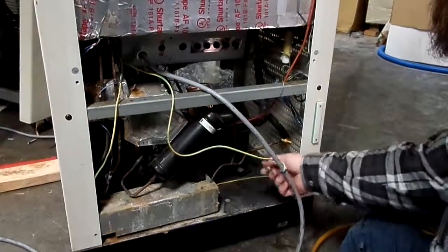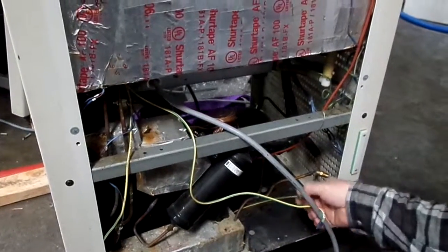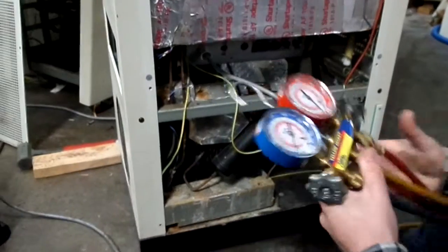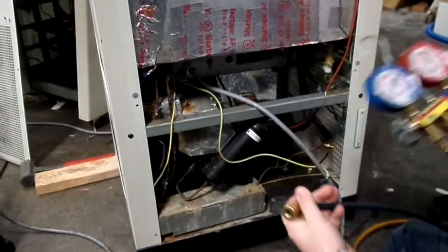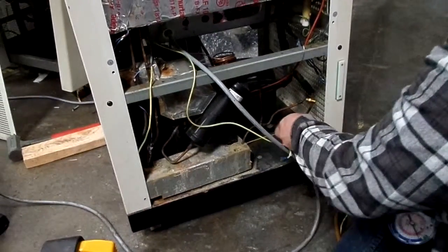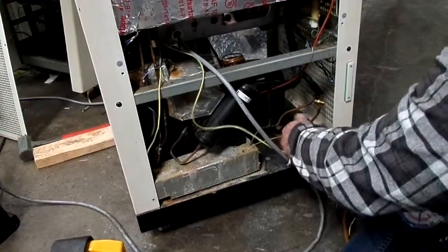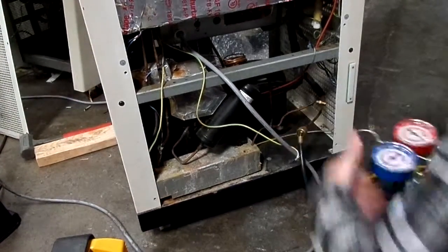So this is our high side, and this guy you can see goes into the compressor on the other side through a long tube. So the low side will be your blue. This, you know, red's high, it's pressure, it's scary red. I don't know if I can figure out a good way to remember that for yourself. Plus the pressures on the gauges are lower, so you can see that.